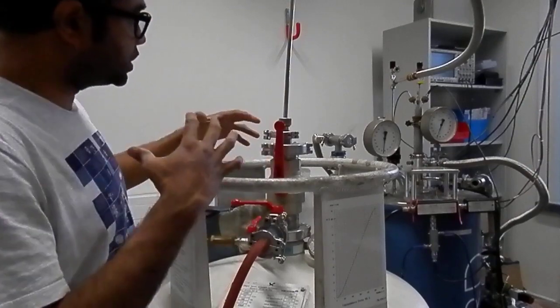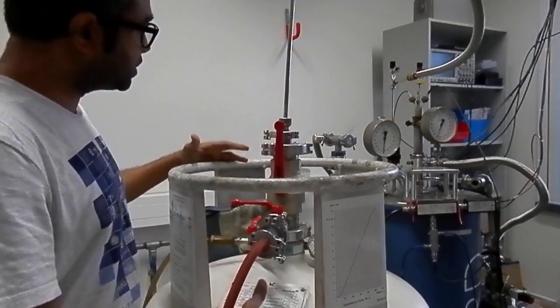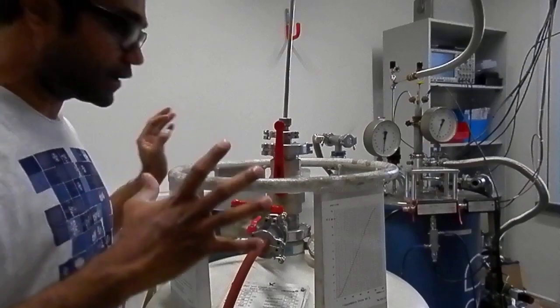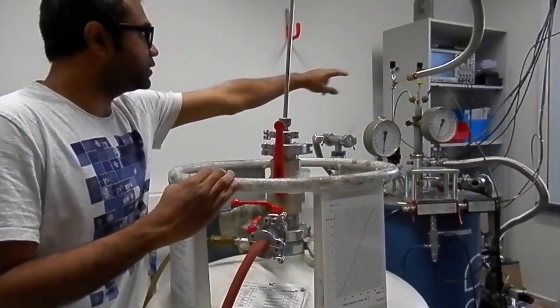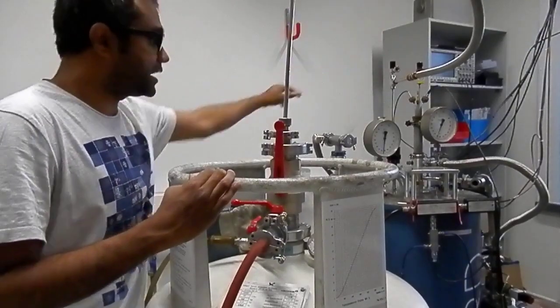Since the way you are transferring helium from this dewar to the magnet uses the principle of siphon, this transfer line is where the liquid helium is going.